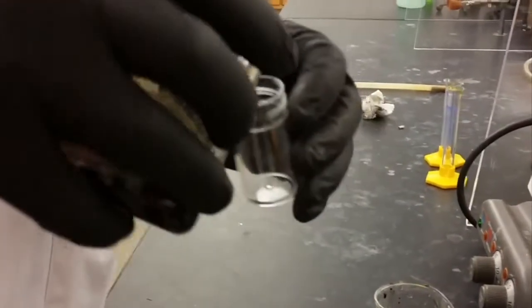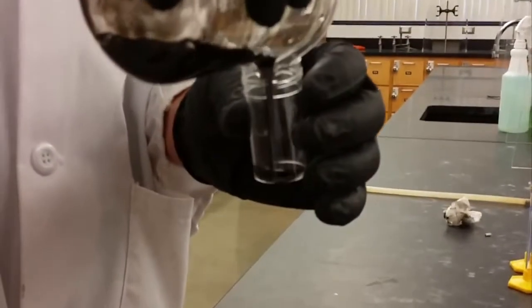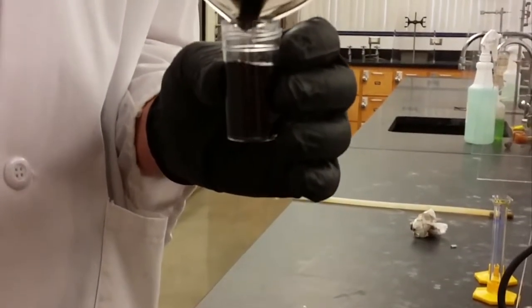Make sure that when you're transferring your ferrofluid to the plastic container, you put it in the clear, transparent container found on the shelves at the front of the lab room and not in the plastic container that the magnet came in.